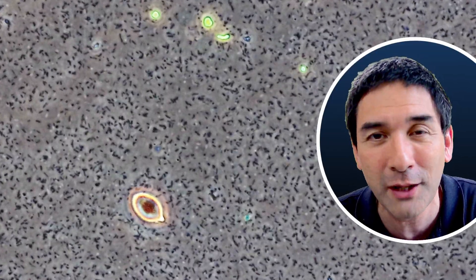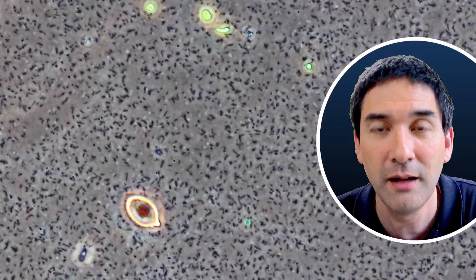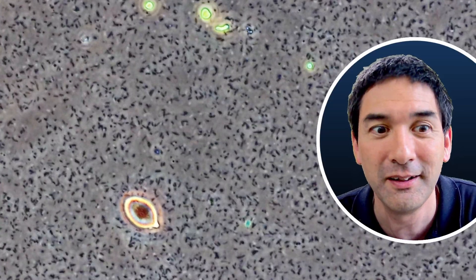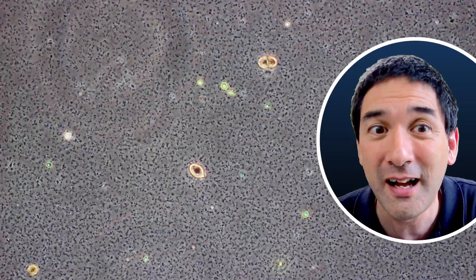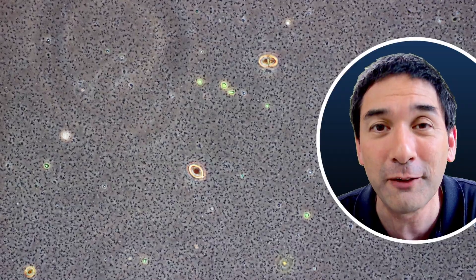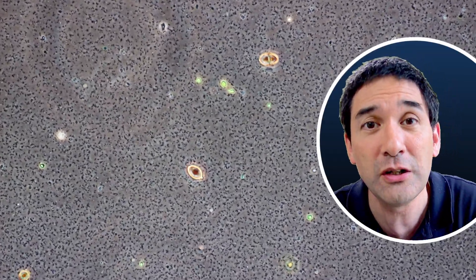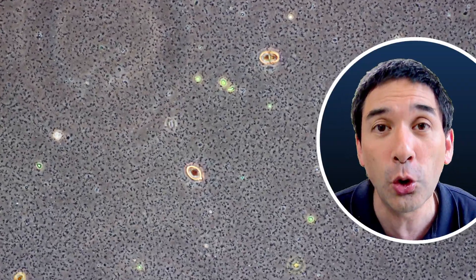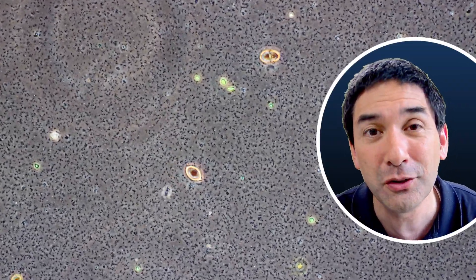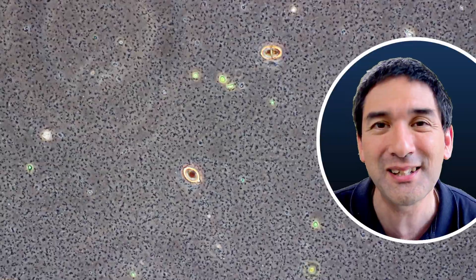For this reason it's a very good idea not to eat moldy food but to simply throw it out. Oh, there's another little creature going through the screen here! As I was saying, throw out your bad food because you don't know what you're eating — and essentially you do not want to eat the poisons and toxins that fungi and bacteria produce. So that's everything I want to share with you today. Happy micro-hunting as always, and I'll see you around next time.